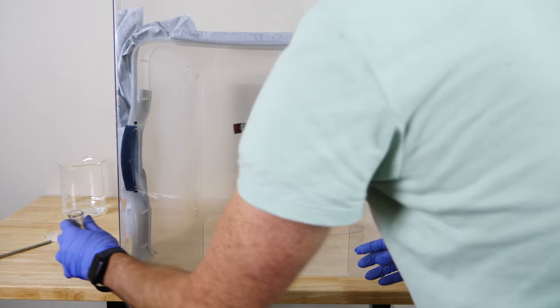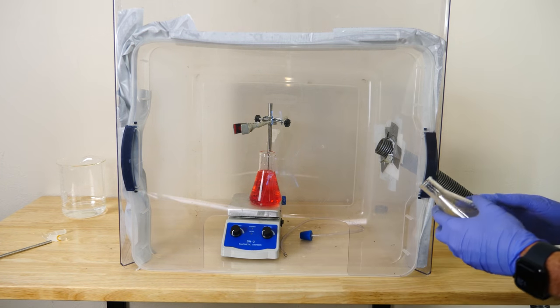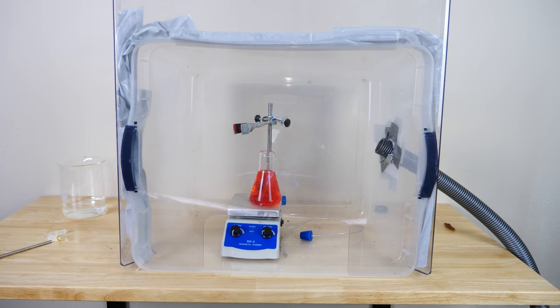Hey everyone, today we're going to be seeing if you can figure out how the nitrogen dioxide fountain works. So first I just need some water. This is a flask of just colored water. It's just red food coloring in it. I just made it red so you can see it a little better.